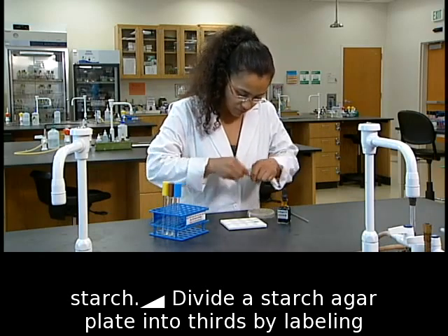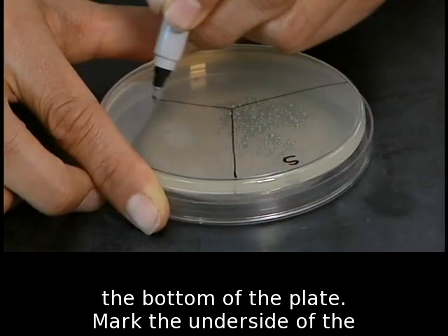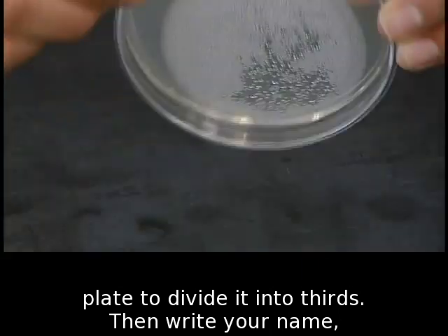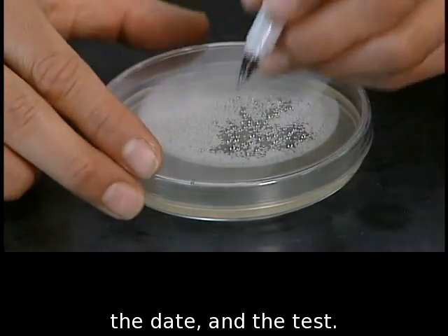Divide a starch agar plate into thirds by labeling the bottom of the plate. Mark the underside of the plate to divide it into thirds. Then write your name, the date, and the test.